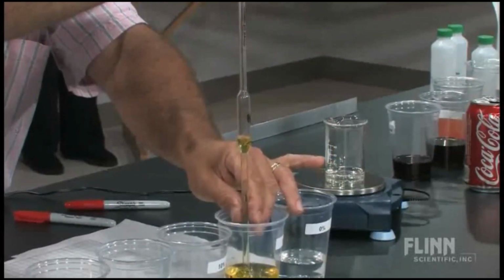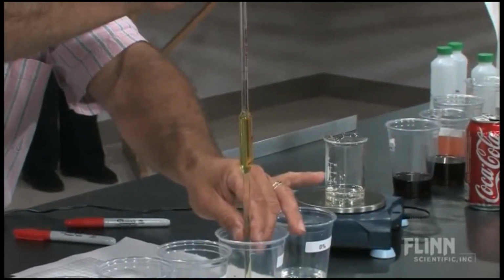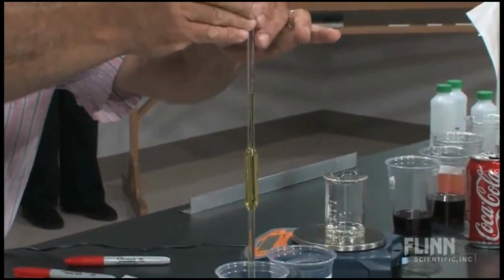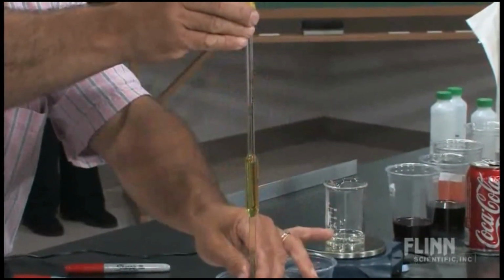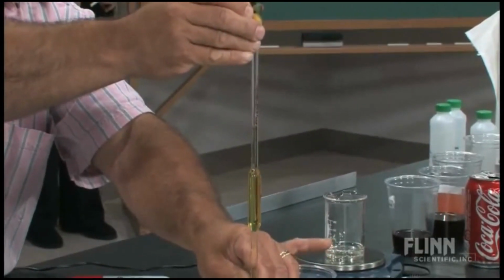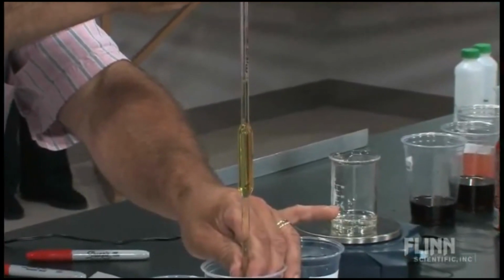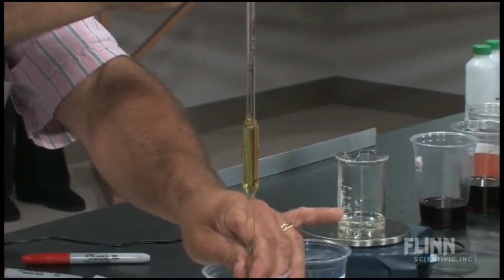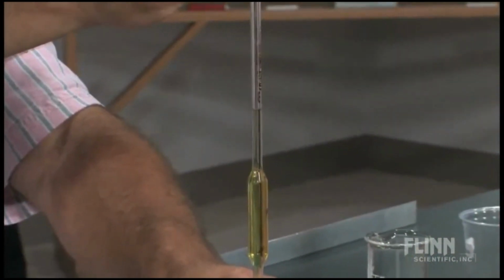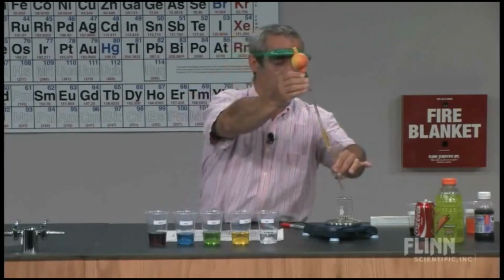Okay? So now we're filling it up with the 5%, and this has sugar in it. Okay? 5 grams per 100 grams of solution. It's 5% by mass. And now we're trying to let out just a little bit. I don't know if you can zoom in on that meniscus there, but ideally you would have it going up and down so that that meniscus is just sitting on top like that. Okay? Takes a little practice to get that technique down, and that's something the students can learn.